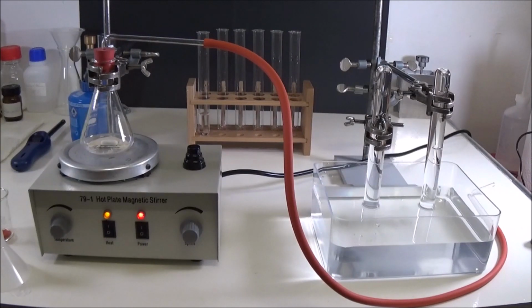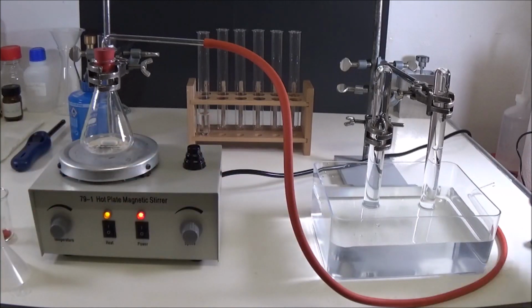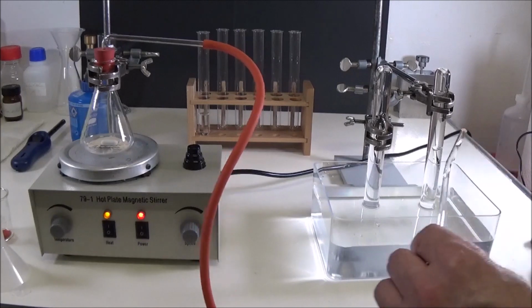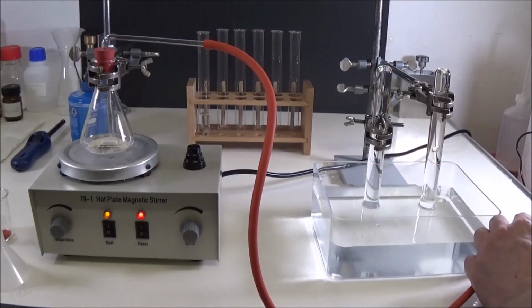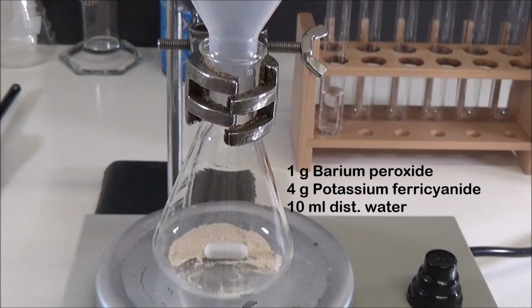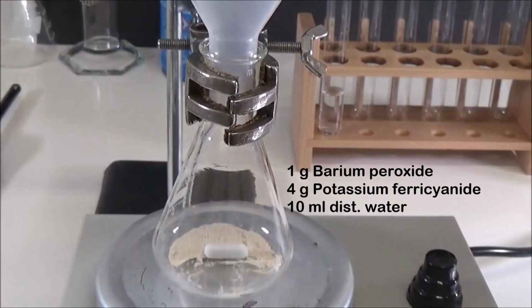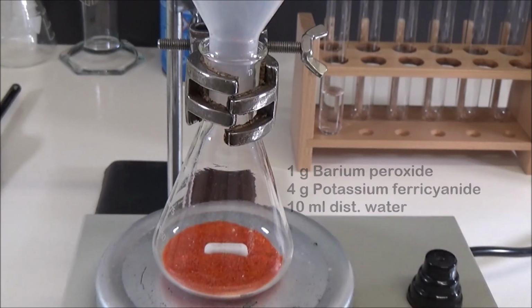Now for the second part of our experiment, the production of oxygen from barium peroxide. To do this, we set up the apparatus shown here, which we use to drain the gas produced and collect it pneumatically underwater in order to be able to identify it properly as oxygen. We placed 1 gram of our homemade barium peroxide in the 100 ml Erlenmeyer flask in advance and first added 4 grams of potassium ferricyanide and then 10 ml of distilled water.